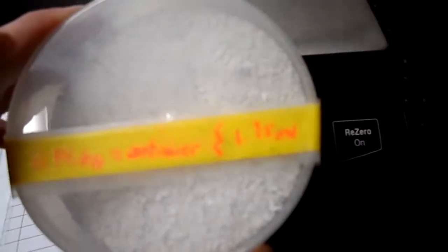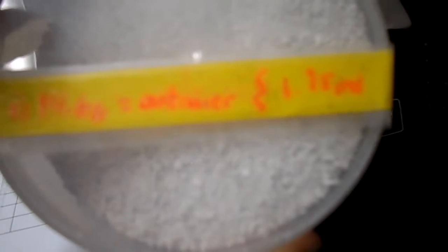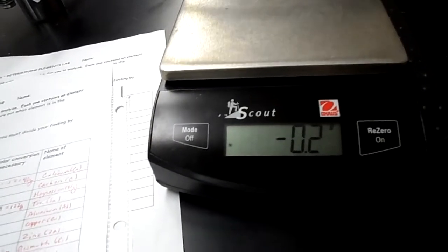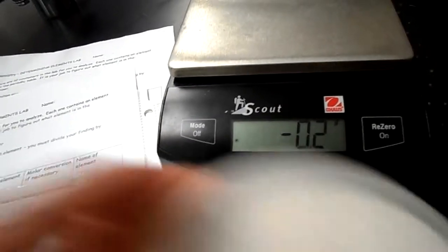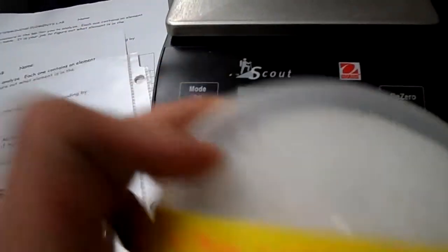Now, if you notice, some of these containers have another value on here. So this one has a value of 1.75 moles. What that means is, on your lab sheet it says molar conversion if necessary. So you will take your weight, which was around 70, and you will divide it by that number of moles, the 1.75 moles, and get an answer. Once you get your answer, that number is the mass number of some element on the periodic table. You can see inside these containers that's a real element. So you just determine which one it was by weight.